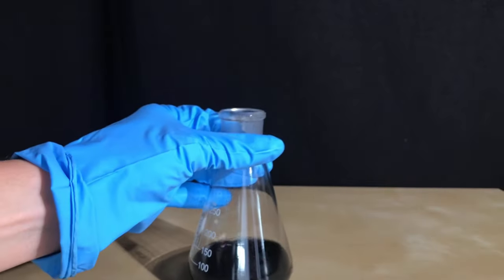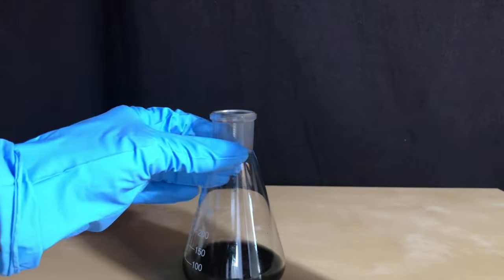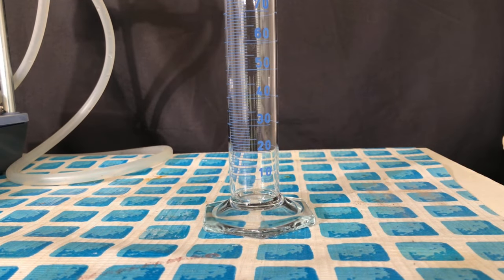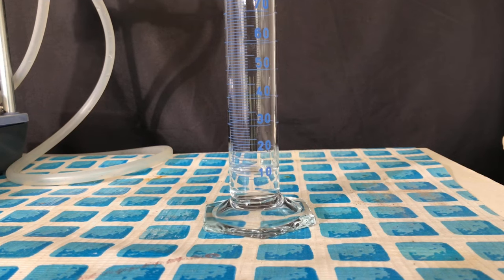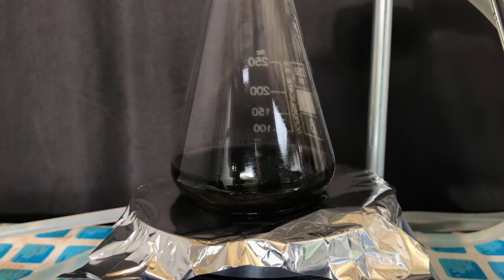This is definitely not enough, and we had to add even more later on. 14 milliliters of glacial acetic acid were measured out. Actually, only 11.6 milliliters are needed, and we ended up using 20 milliliters. By using copper acetate directly, you can avoid that problem.